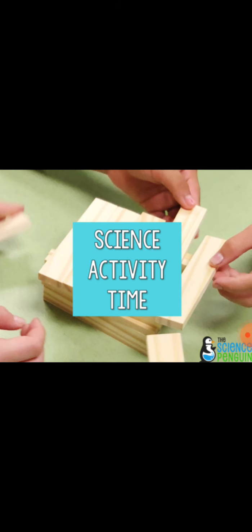Today we will be performing an activity on the topic separation of substances from its mixture. I hope you remember we did chapter number 5, separation of substances. We discussed different methods of separating components from its mixture.